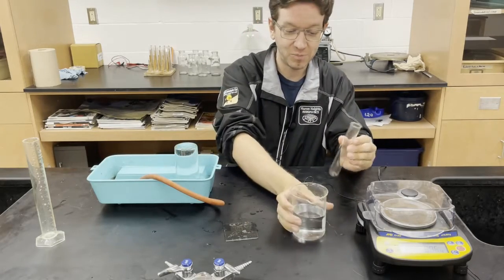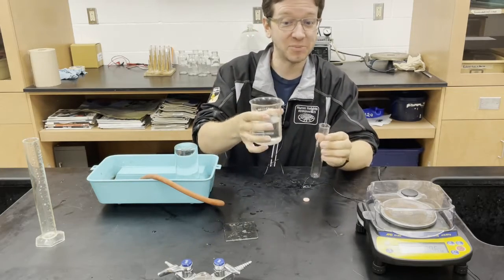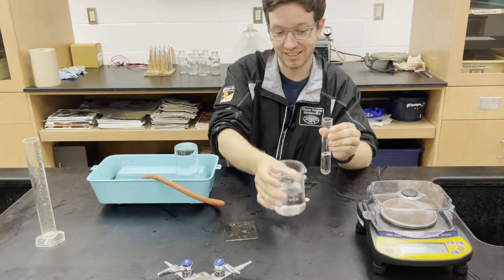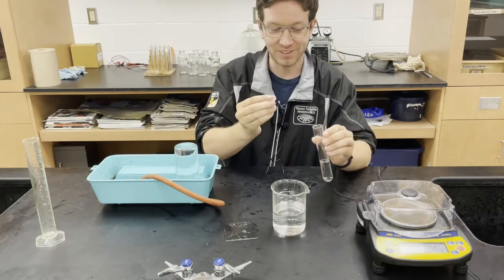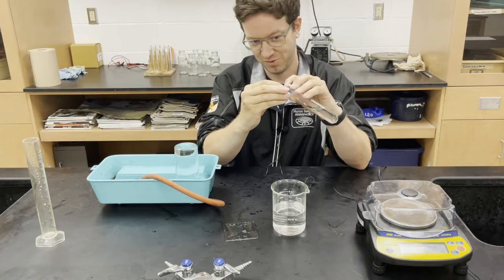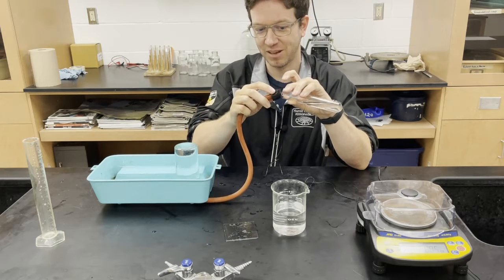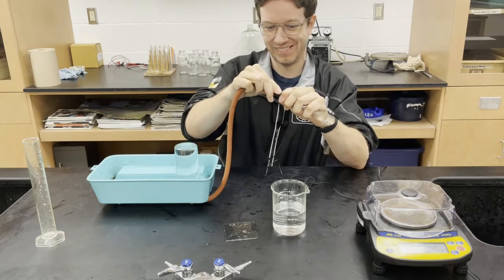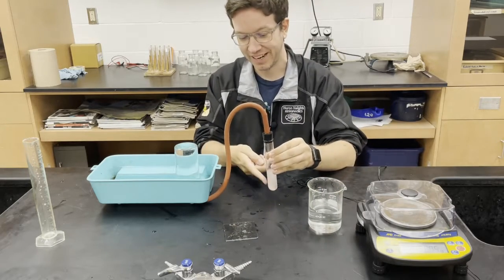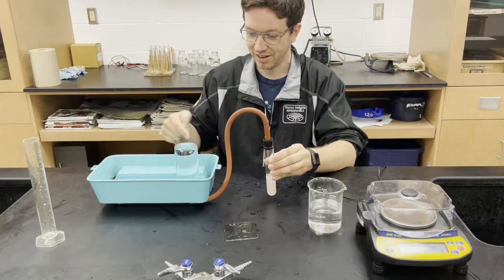Next, we are going to fill this test tube up with about one-third hydrochloric acid. We don't need an exact measurement because this is going to be in excess — we have more than enough hydrochloric acid to completely react with all the calcium carbonate in the Tums. This is where some finesse comes in. We want to place the Tums inside without reacting it because we want to place the stopper on first. Then we place the stopper on it and then we can have it react. We're getting gas being produced from the bubbles — it's going to rise, come through here, and gather inside.